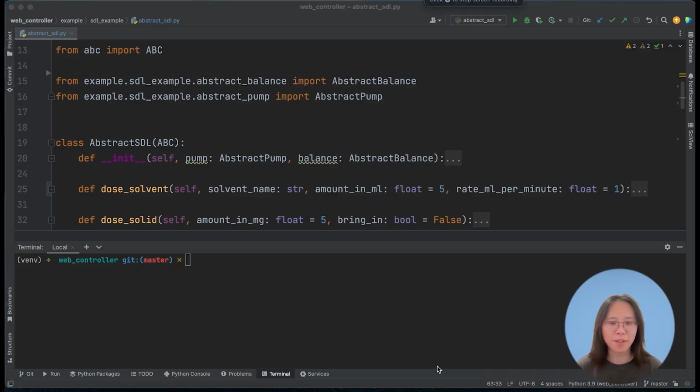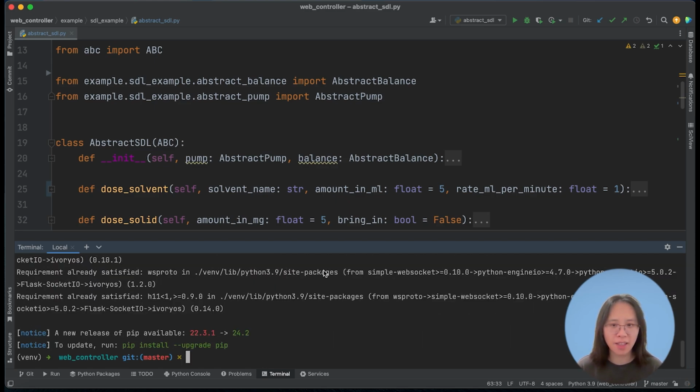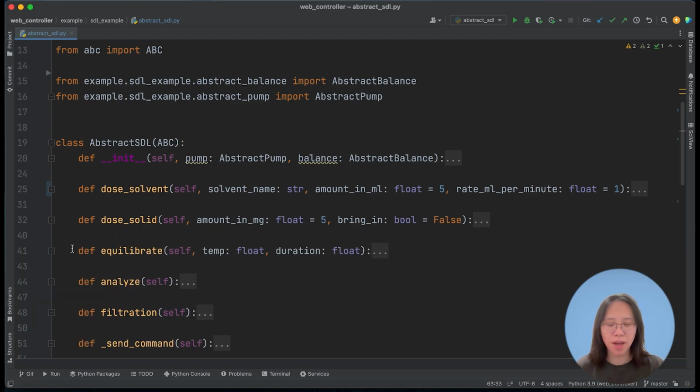In this part, I will show you how to install and use some key features of IvoryOS. Let's start with installation. Over the terminal or command line, you can type pip install ivoryos, and this will take a while to install all the packages. I already have this installed, so let's move into the Python scripts.